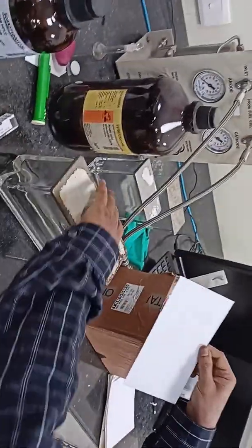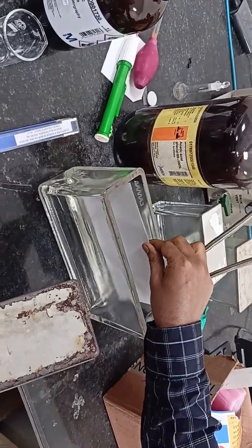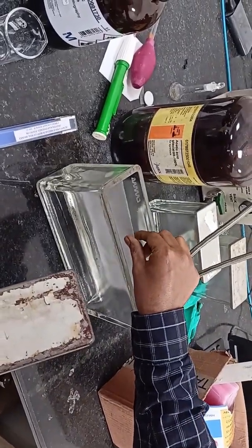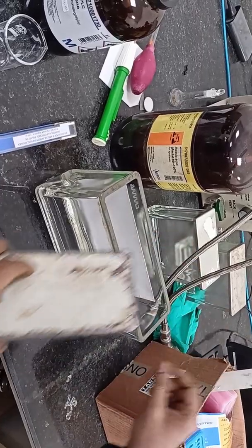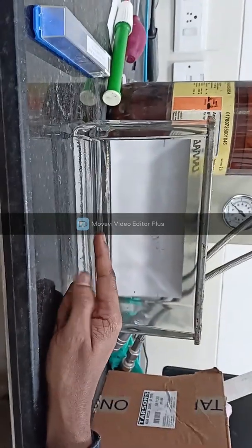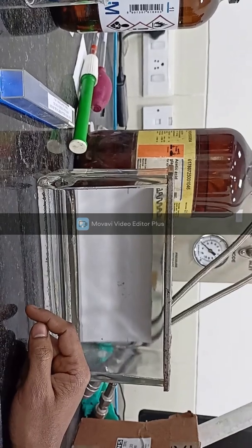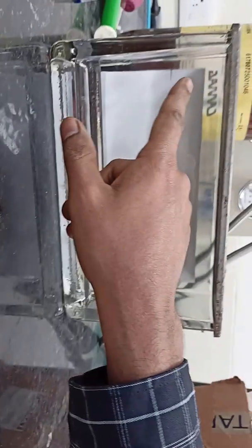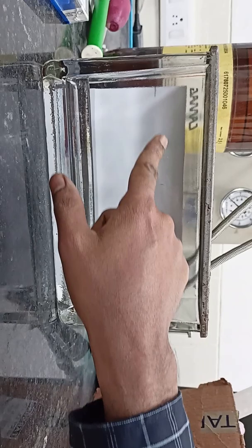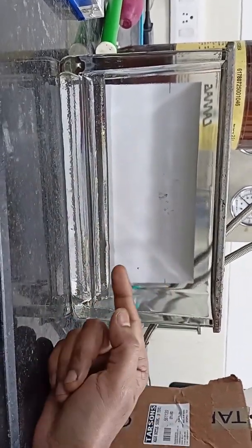Then after 20 minutes we will put this plate into that glass developing chamber. So the bands have been prepared over this plate. Now we are going to dip this plate into this glass chamber after 20 minutes of preparing the solvent. We will keep it at a slanting angle. Now you can see the solvent is rising up inside the stationary phase. We will wait till the solvent comes up to the mark. After that we will remove this plate and dry it.